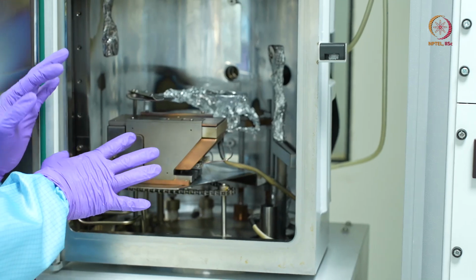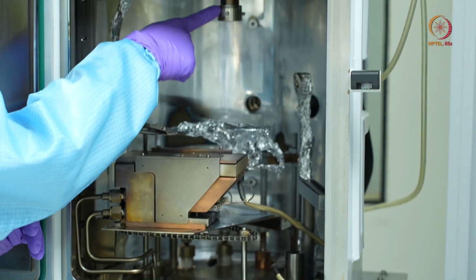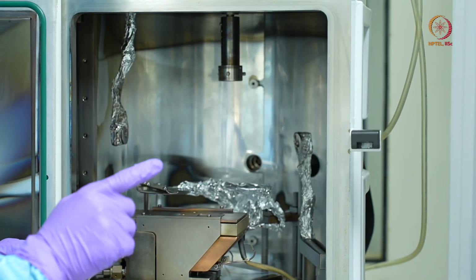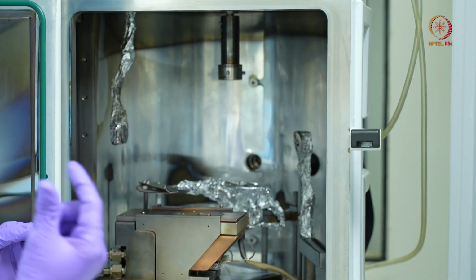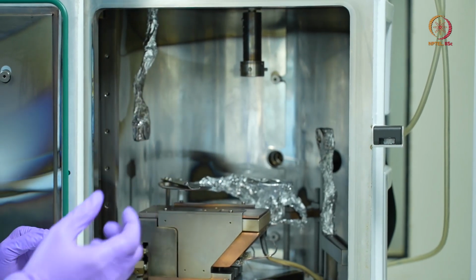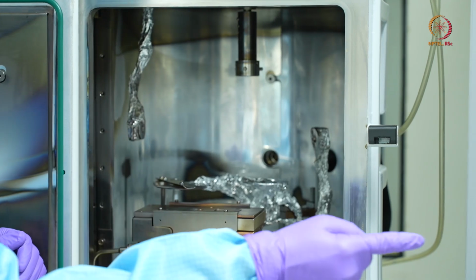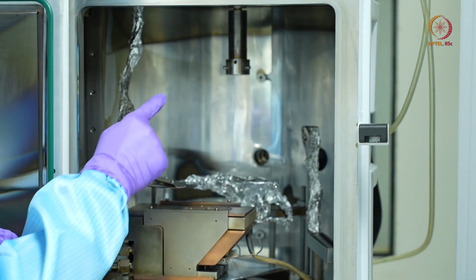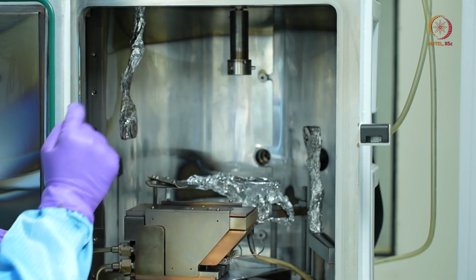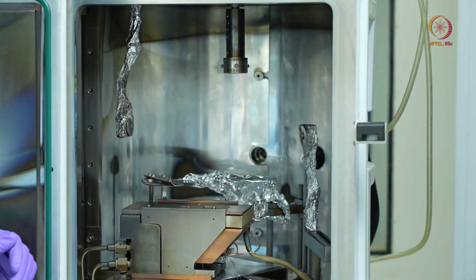And now we can have a look inside of what all things we have. The first is the spindle on which my substrate holder will be mounted. Like I said, it has a rotation drive, which I use for having a uniform deposition. So if you can turn this on. Okay, once you switch on the rotary drive, this spindle starts rotating. Right now it is set at 3 rpm. We can switch it off.